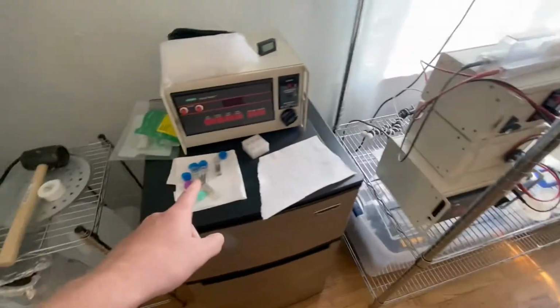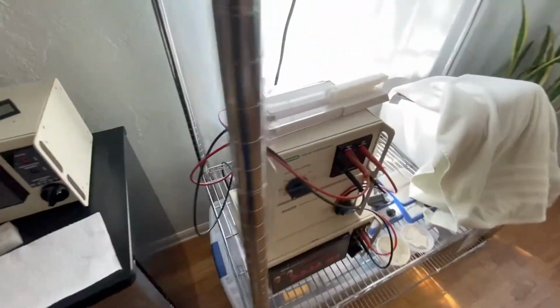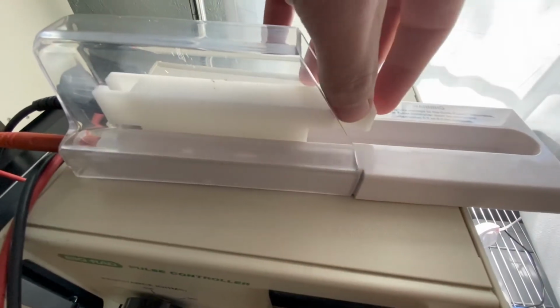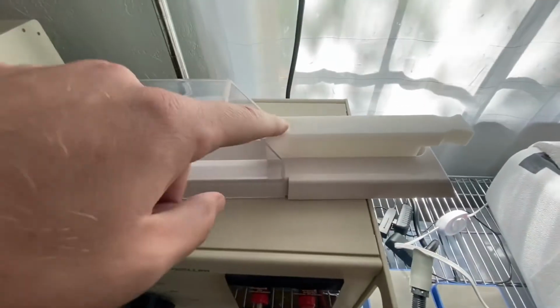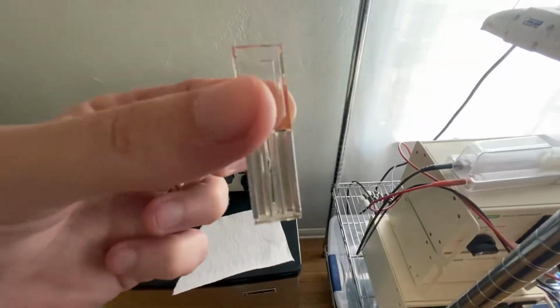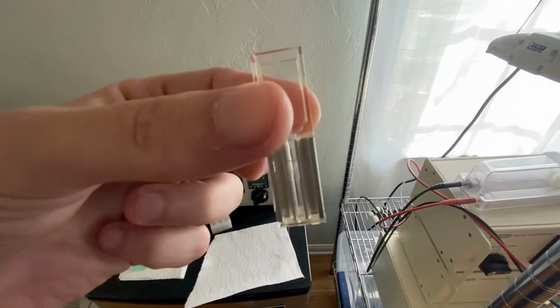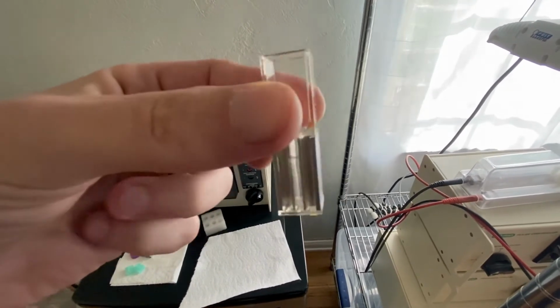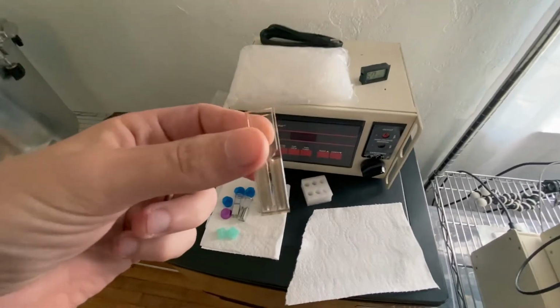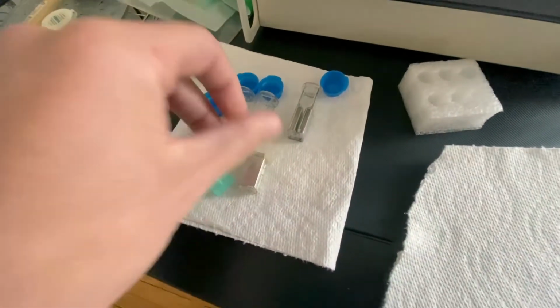The other really important thing that we want to work out is the recovery procedure. That is, after we put the cuvette into this little hole and we zap it, we actually need to put in some fresh LB media inside the cuvette with the freshly electroporated cells. And that's going to help cool them down and also begin to allow the cells to recover and begin to express the plasmid that was put into them.